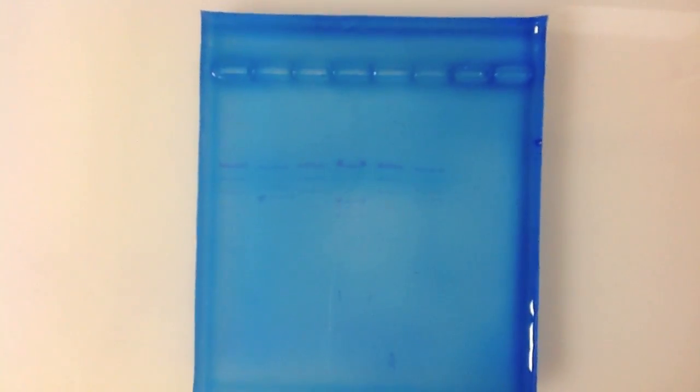Once the gel has fully de-stained, we can then begin to visualize the bands of DNA, similar to the way we were able to visualize them with the intercalating agent.